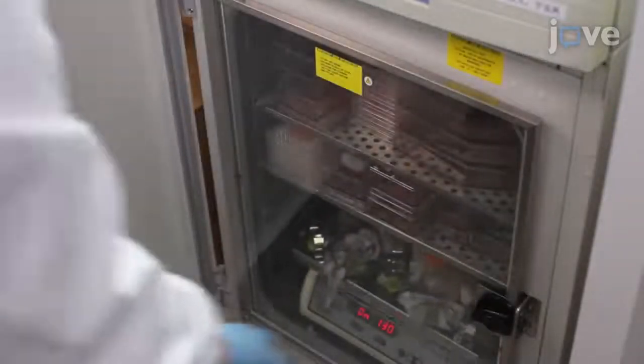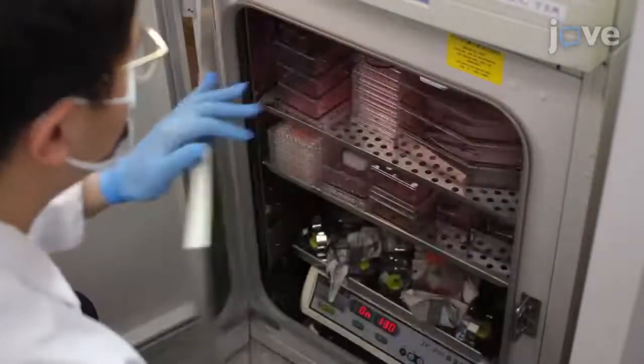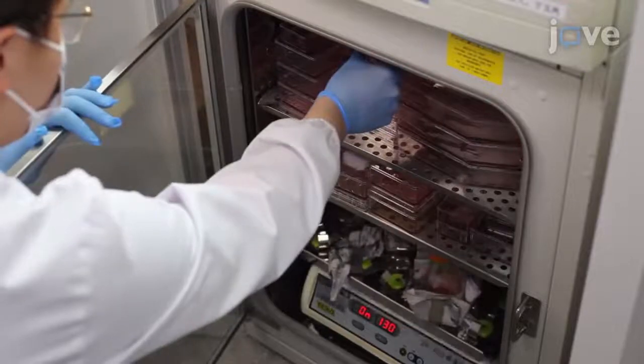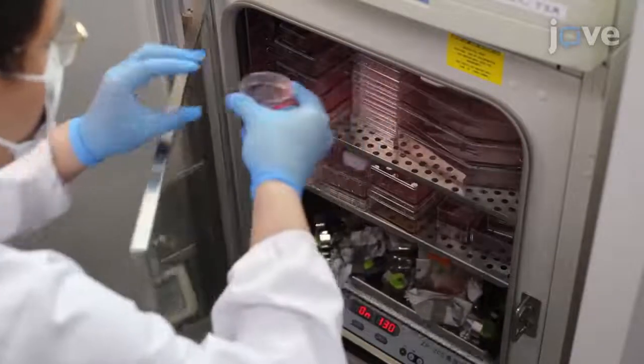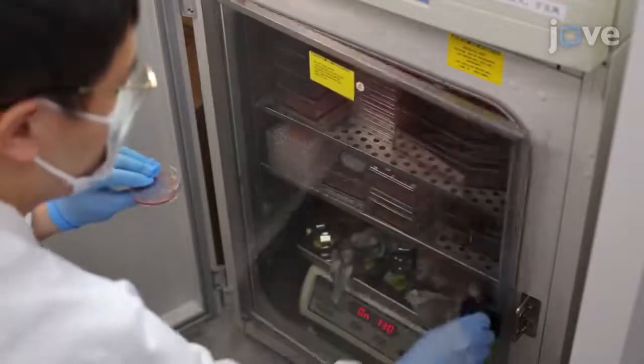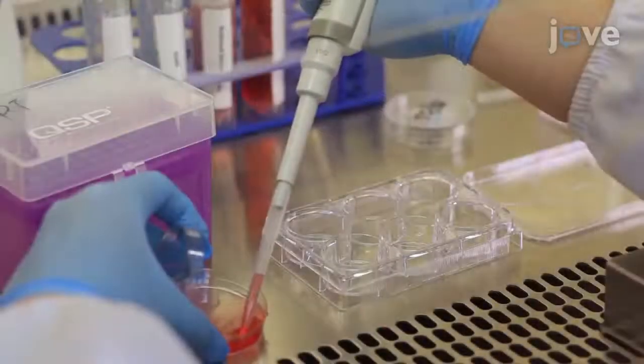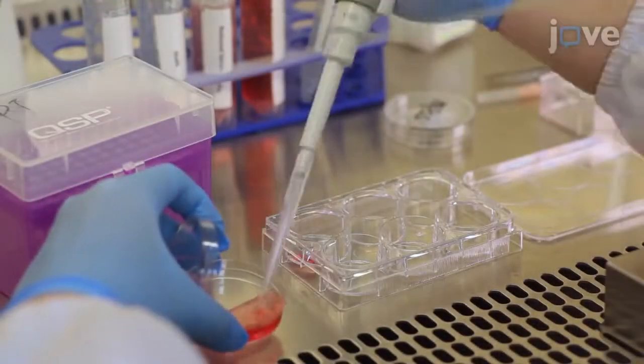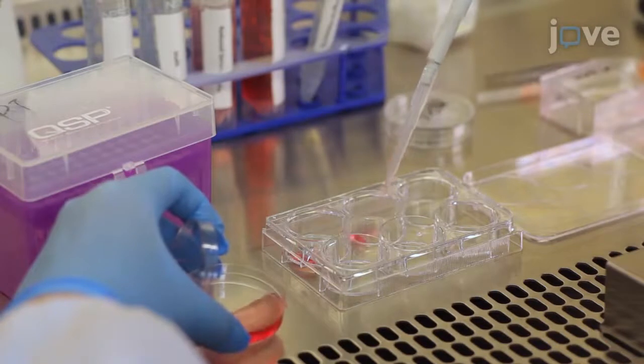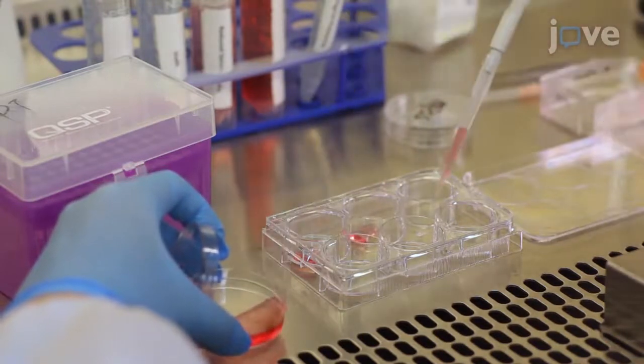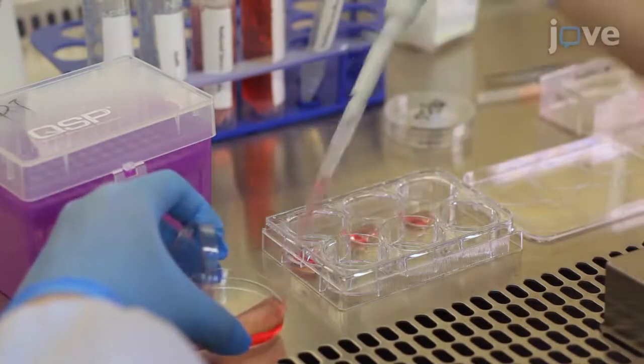Culture an HN4 cell line from head and neck cell squamous carcinoma as described in the text protocol. One day before transfection, plate 0.5 million cells in 2 milliliters per well of culture medium without antibiotics in 6-well plates.